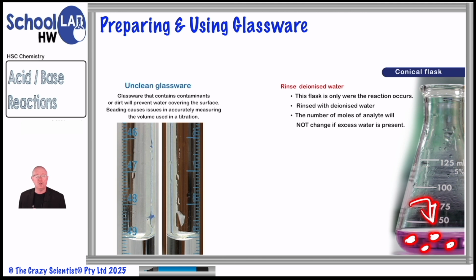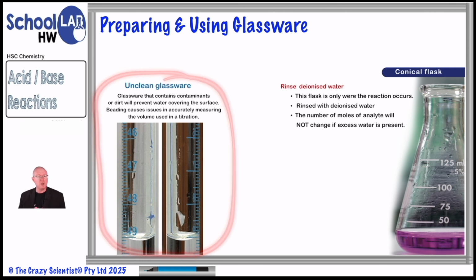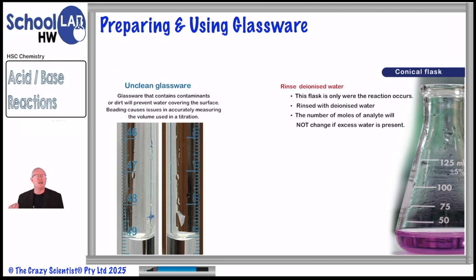So we don't need to ensure that we rinse and dry this out, but we do need to ensure that we have deionized water to ensure there's no contaminants in there. Okay? Having clean glassware is something that you should be checking as well. The whole point of volumetric analysis is that you want to measure precise volumes of a titrant added to your analyte. If you have unclean glassware, you can see that it beads here, and we've got volume of water stuck to the sides. So when you add it to your analyte, you're going to have an incorrect volume measurement because some of it's going to be stuck on the sides of the burette. So having a clean glassware does actually make a difference.